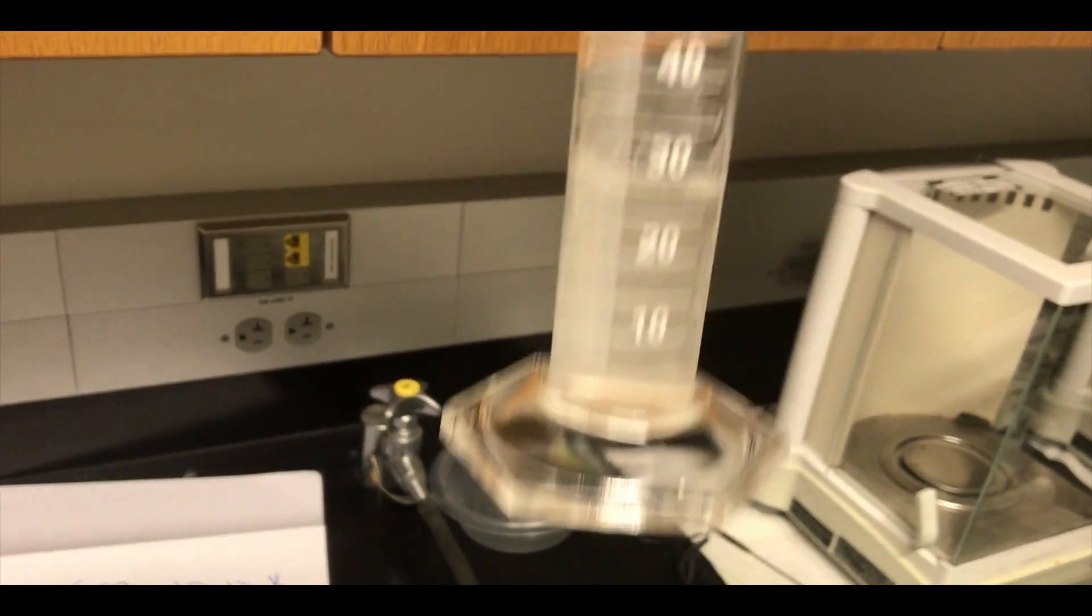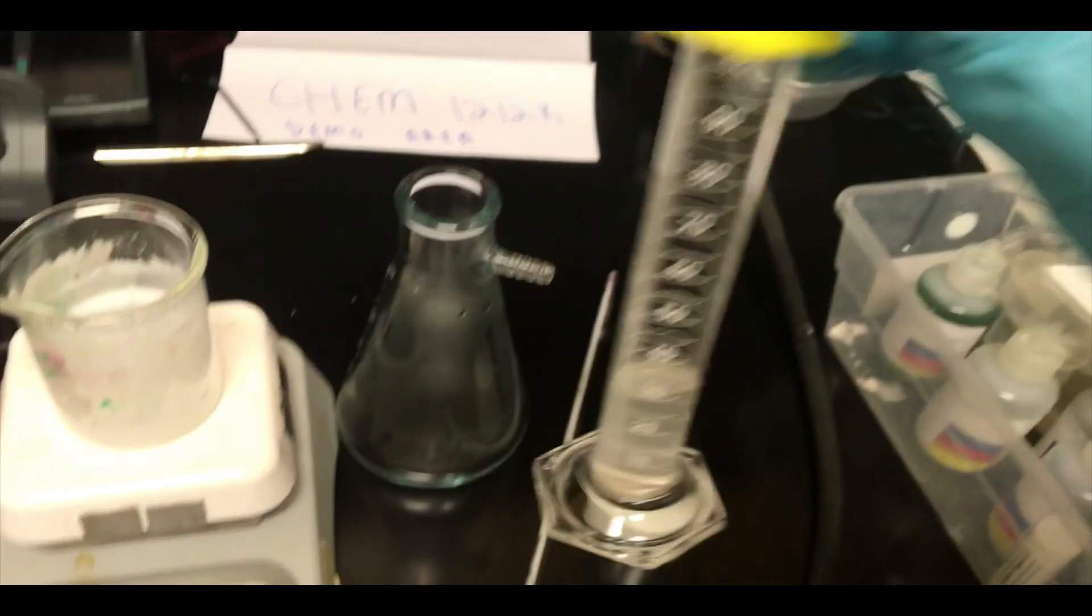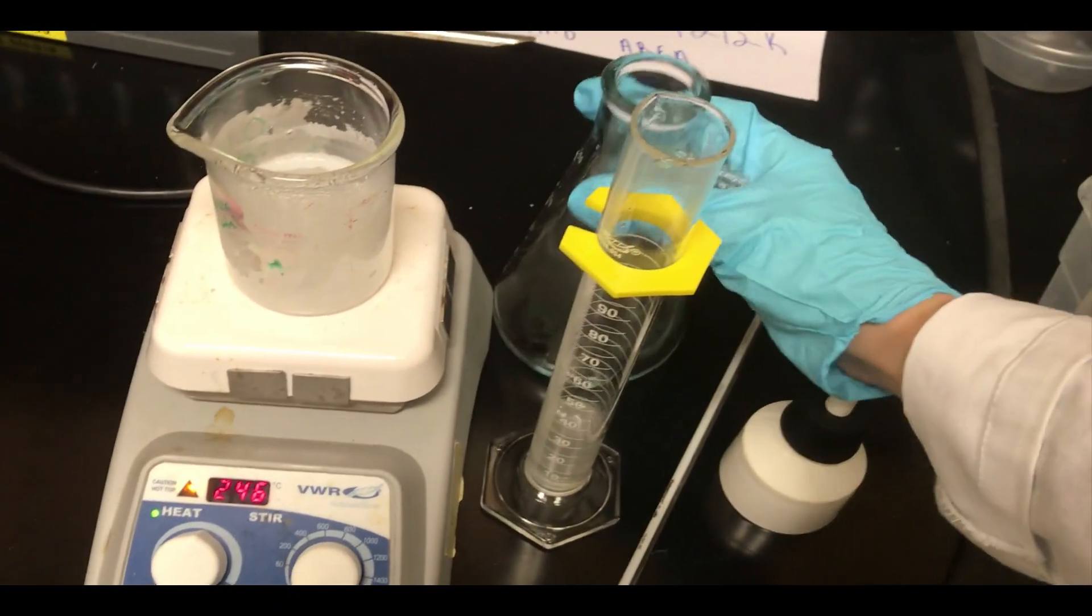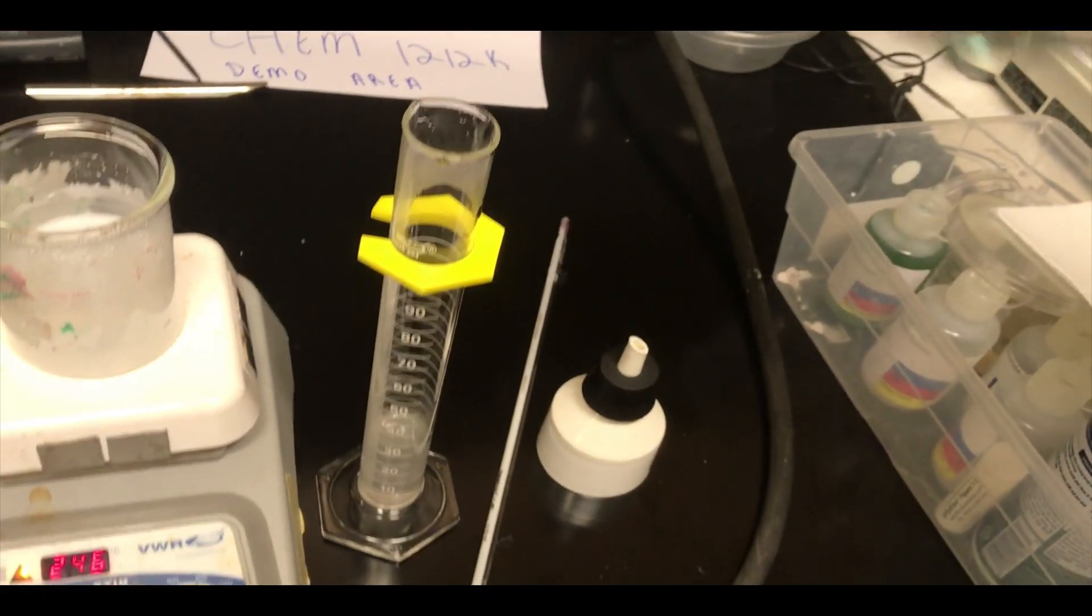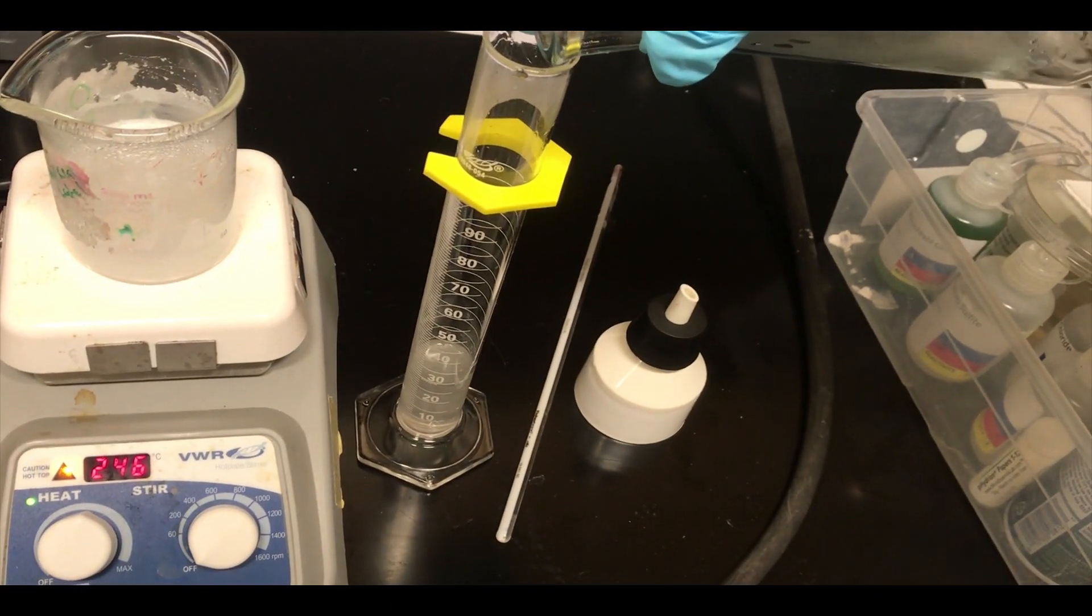So we're going to want to take a look at that and see what the exact measurement is. I'm actually going to add a little bit more to get us up to the 30 milliliter line or so. And again, getting there exactly is not critical.